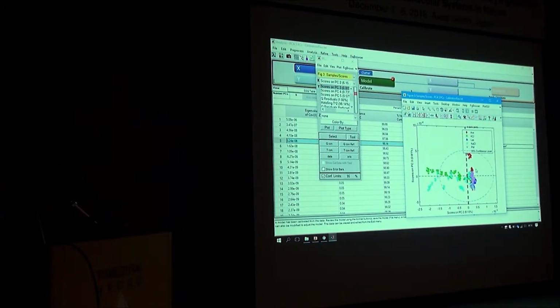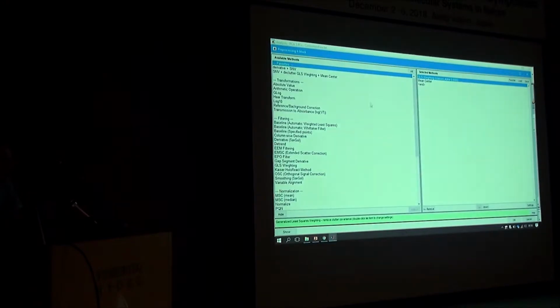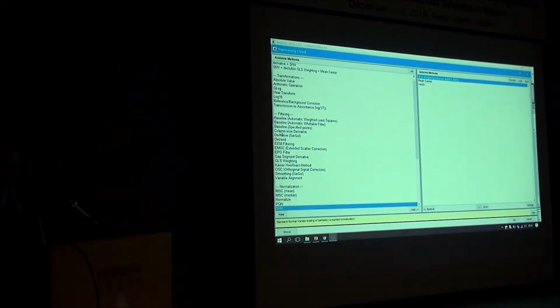SNV is quite important to correct for the scatter. EPO or GLS weighting cannot correct for that multiplicative effect. So you need to add a scatter correction method. EMSC, on the other hand, can do that if you can apply a scatter correction filter on top. That could do a similar sort of effect. So let's add an SNV to this. Pre-processing. SNV.